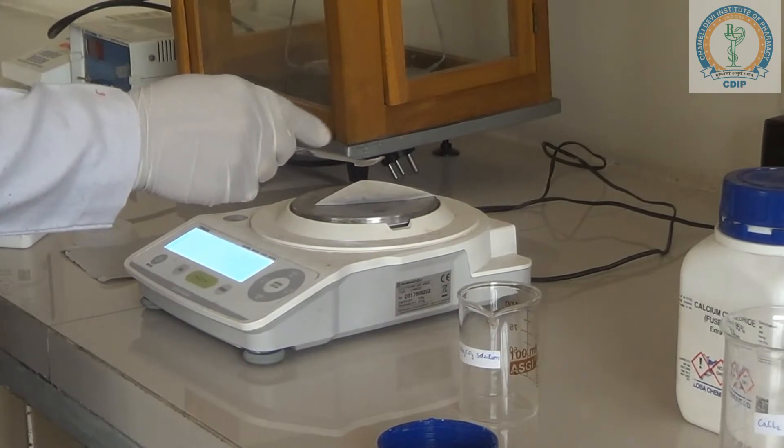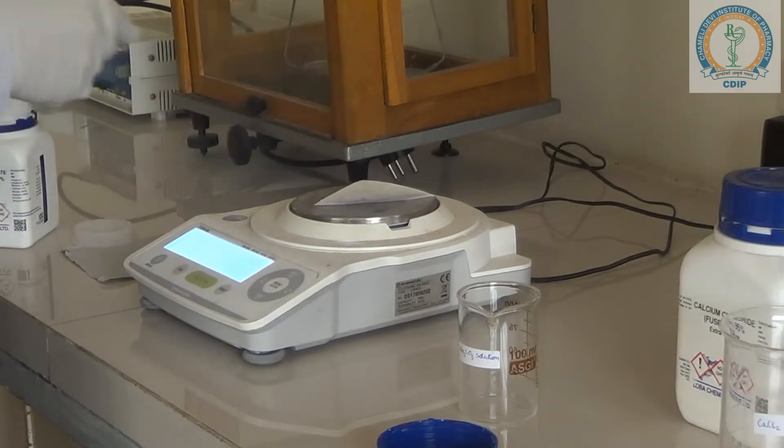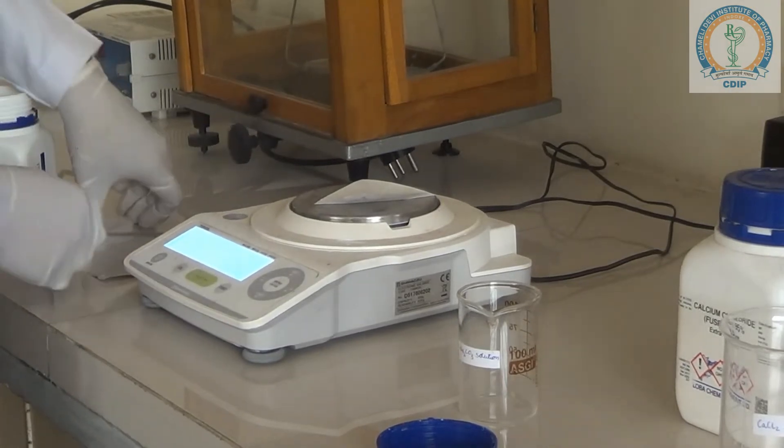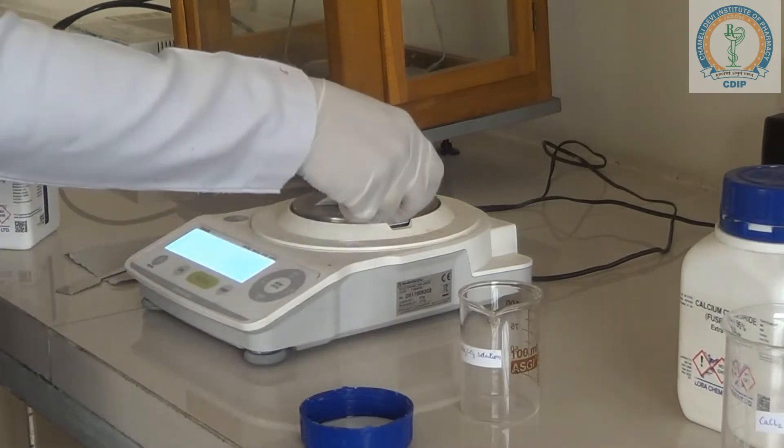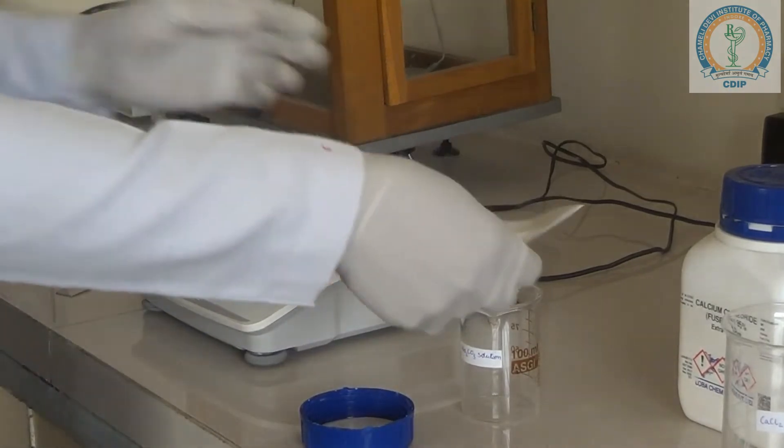So we need to transfer it to the beaker. Here, it is 1 gram of sodium carbonate. So we need to transfer it to the beaker.